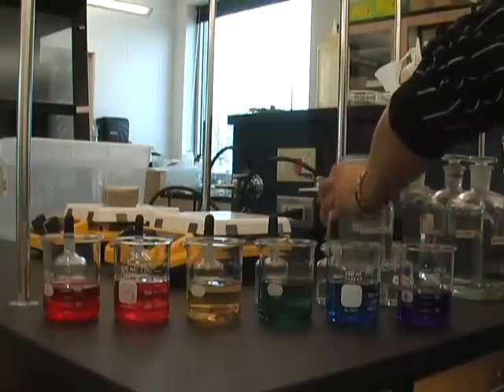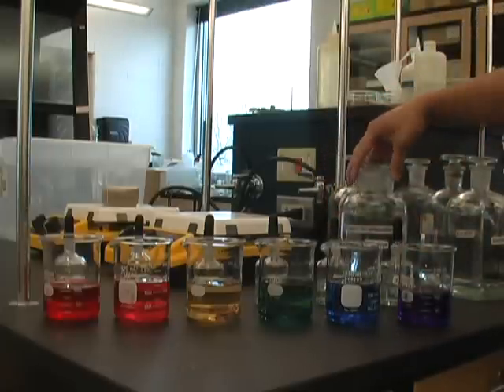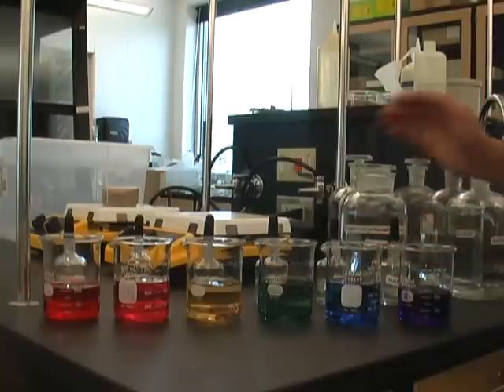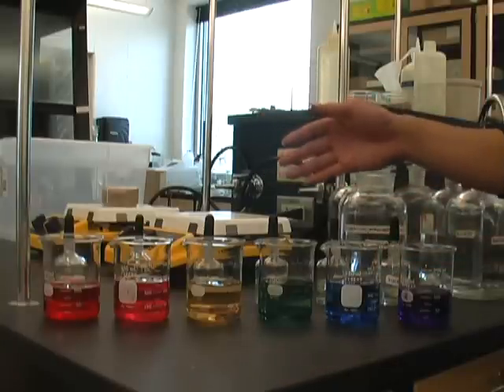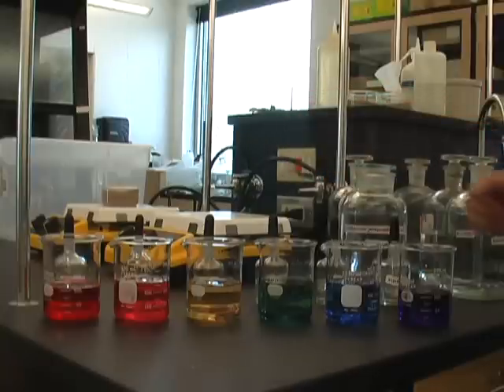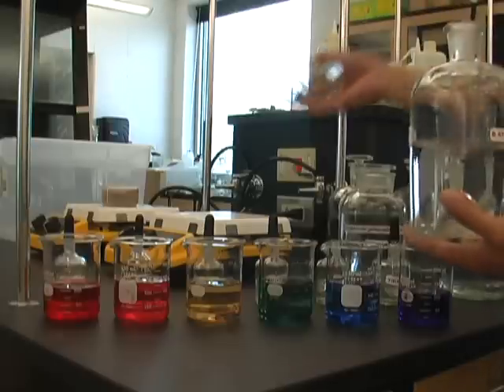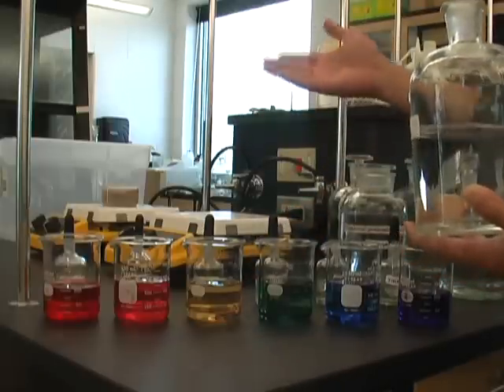There you go, you have all colors of the rainbow, also known as ROYGBIV. Basically, what the base indicators did was change colors, so now you know that you have more base in your solution than you do acid. Now I'm going to add hydrochloric acid to change the colors back to clear.